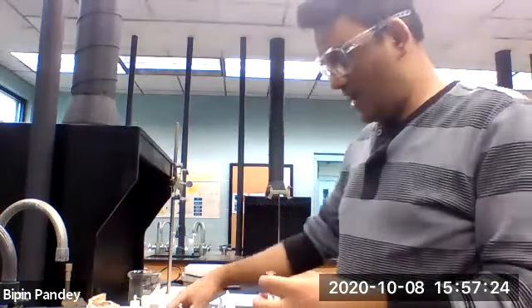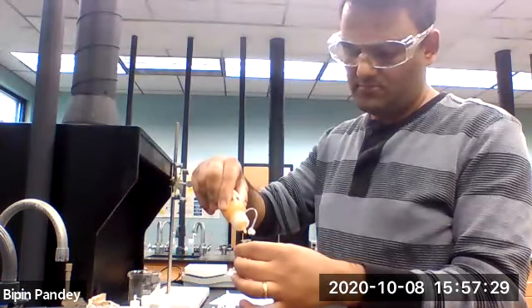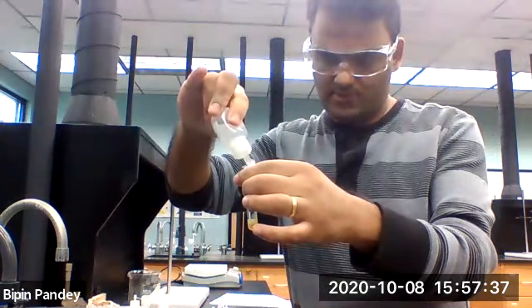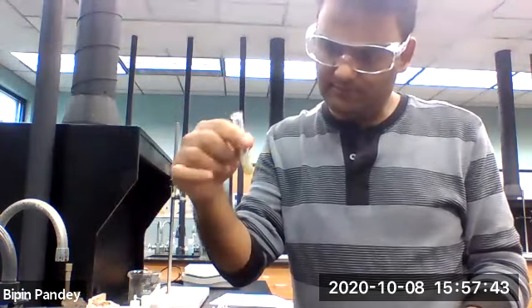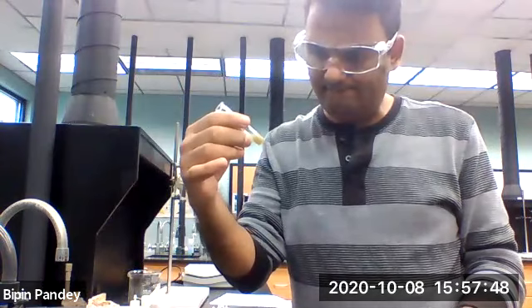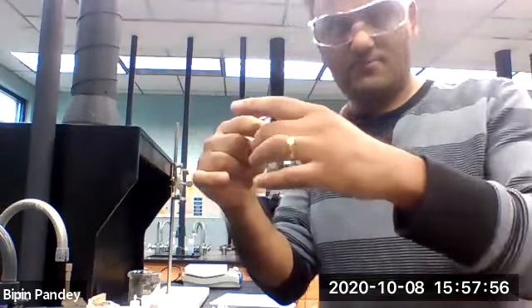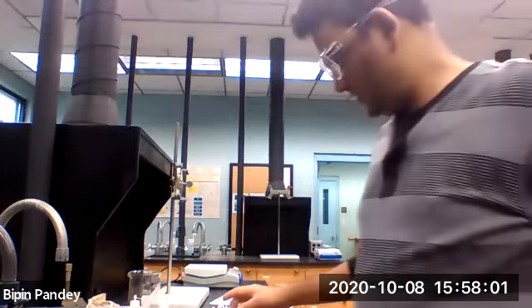All right, now let's do iron and phosphate. Iron and the phosphate. Okay, yeah, this time it's giving us the precipitate. It looks like a muddy precipitate to me. So iron reacted with phosphate, gave a precipitate.